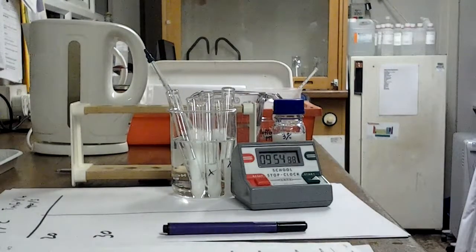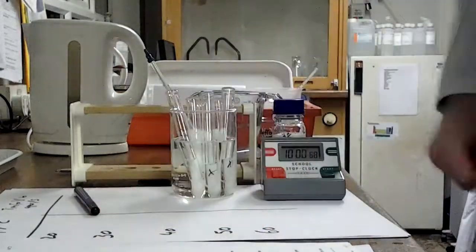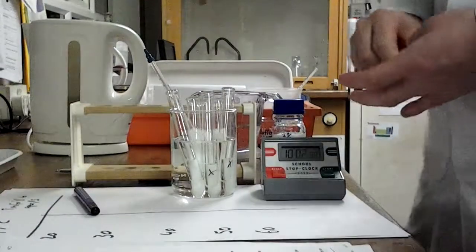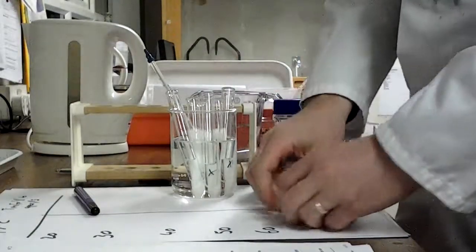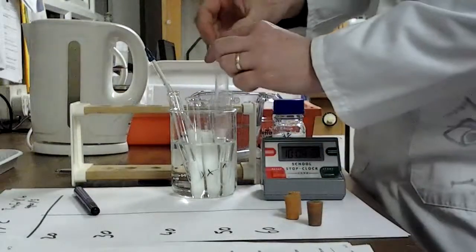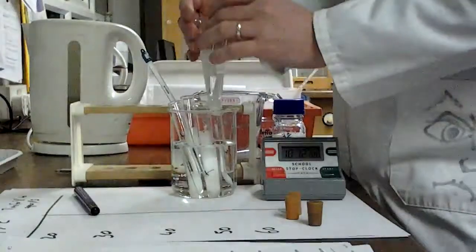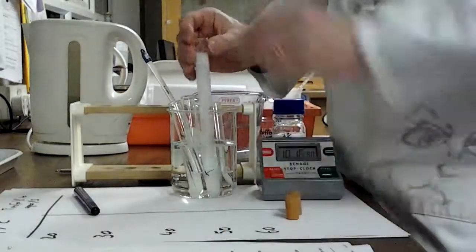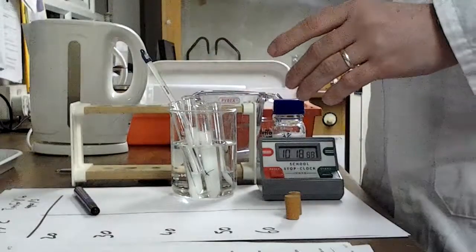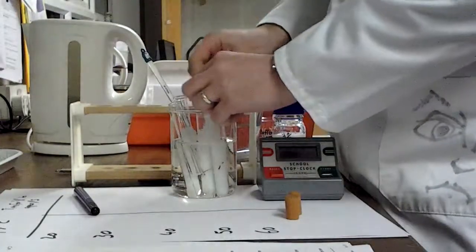Okay, so as you can see, our 10 minutes is nearly up, which means that equilibration should have happened. Everything in here is now sat at 20 degrees and we're ready to do the experiment. So, what I'm going to do is I'm going to take 1 tube of enzyme and 1 tube of milk with an X, okay, and I'm going to mix it. And I need to mix it reasonably well, hence the bung. So when it goes, invert it, that's now mixed, and I'm going to leave that in there.